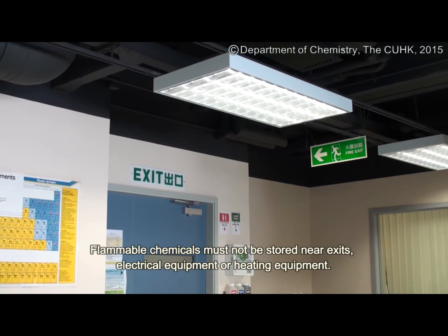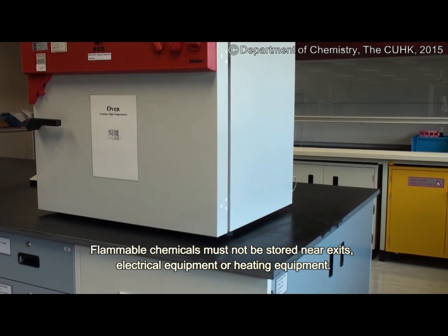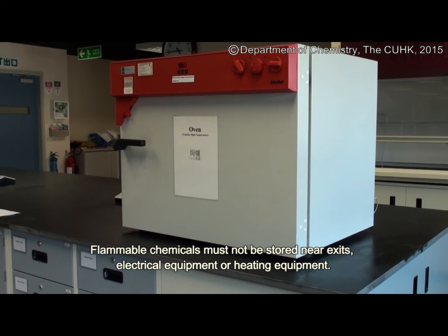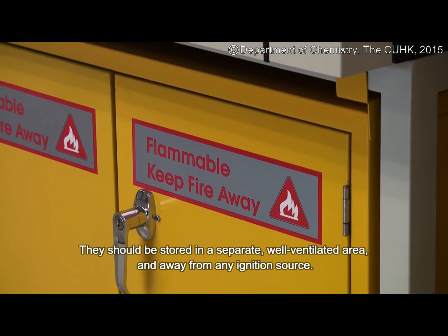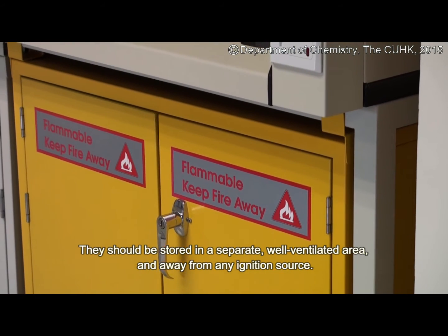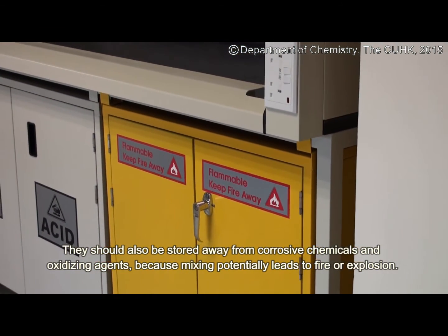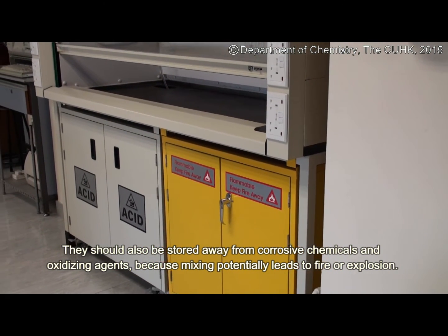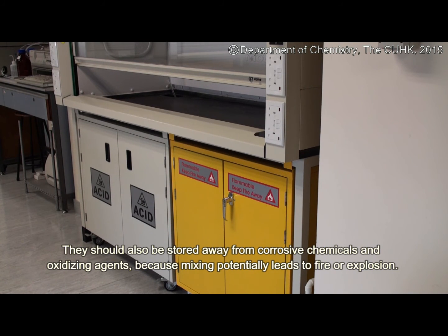Flammable chemicals must not be stored near exits, electrical equipment, or heating equipment. They should be stored in a separate, well-ventilated area and away from any ignition source. They should also be stored away from corrosive chemicals and oxidizing agents, because mixing potentially leads to fire or explosion.